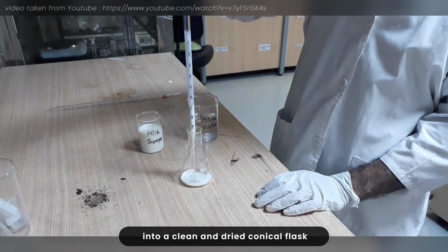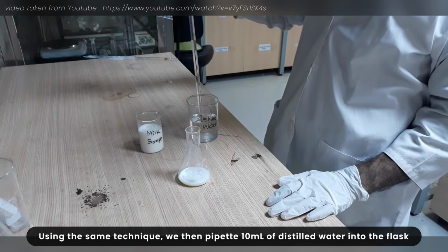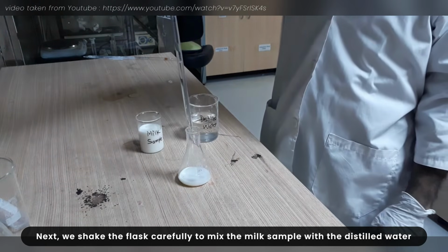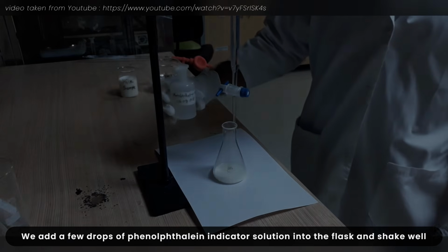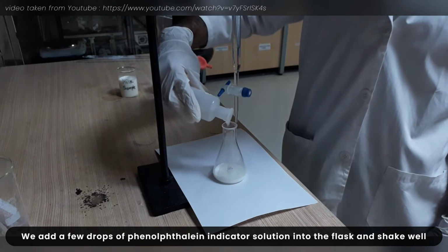By using a 10 ml pipette, we transfer 10 ml of the milk sample into a clean and dry conical flask. Using the same technique, we then pipette 10 ml of distilled water into the flask to dilute the milk sample. Next, we shake the flask carefully to mix the milk sample with the distilled water. We add a few drops of phenolphthalein indicator solution into the flask and shake well.